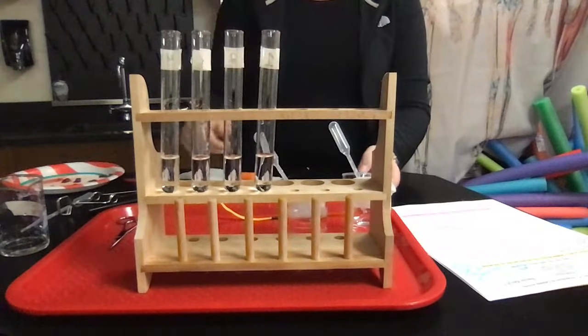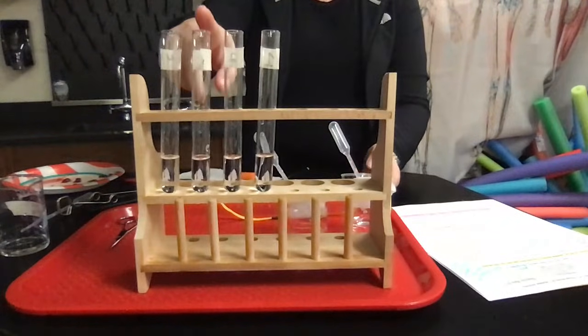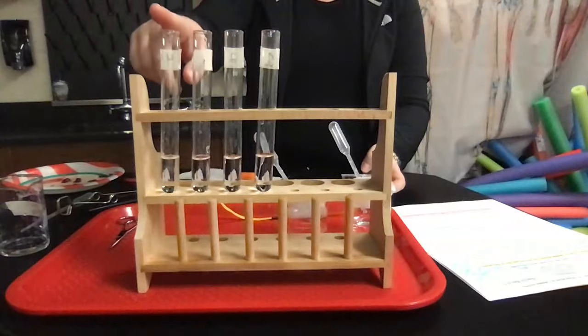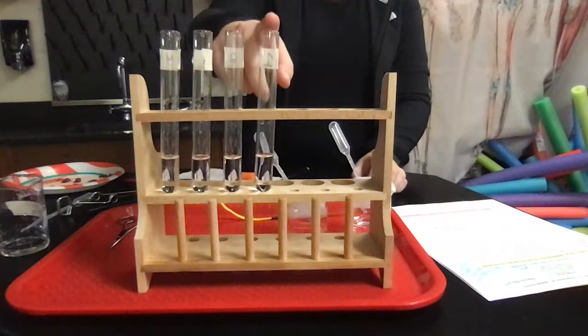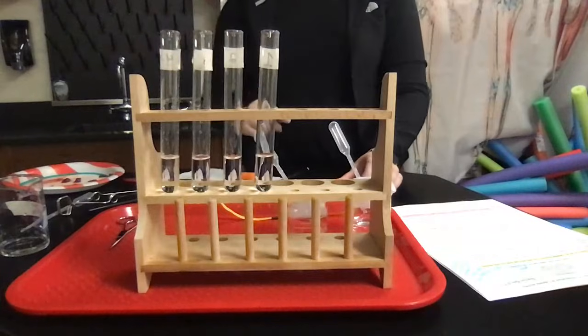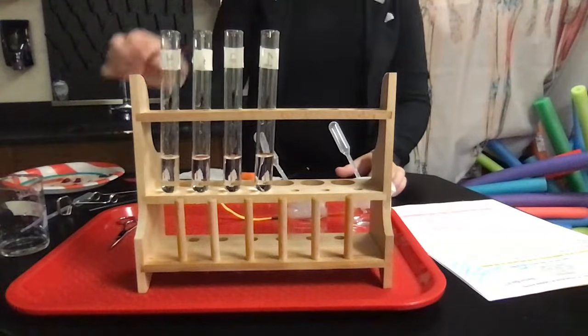And then I have test tube 3, which is going to be about maybe an 8, so just over neutral. And then test tube 4 is going to be more like a 12. Okay, so I have a mild acid, a little bit stronger acid, a little bit more neutral, and then pretty basic. Okay, so I'm going to go ahead and add my liver to each one of these.